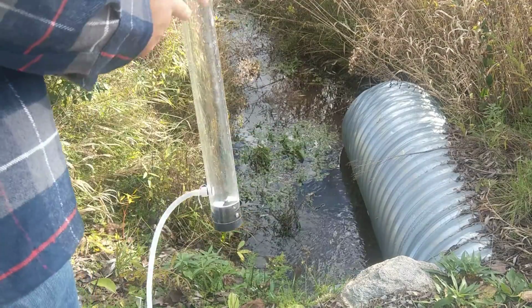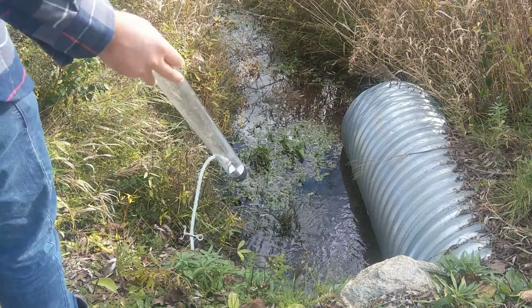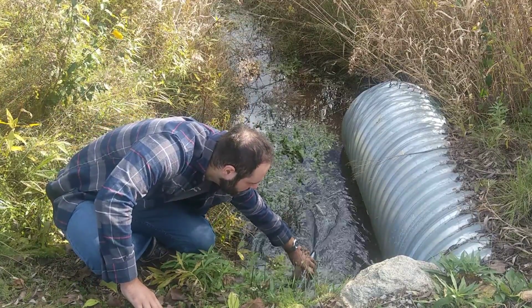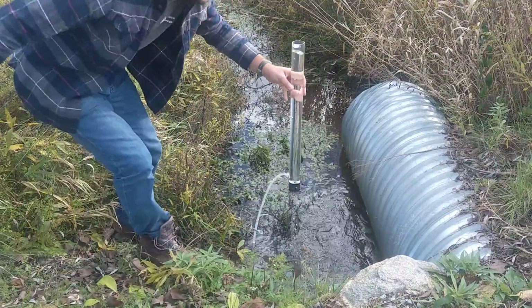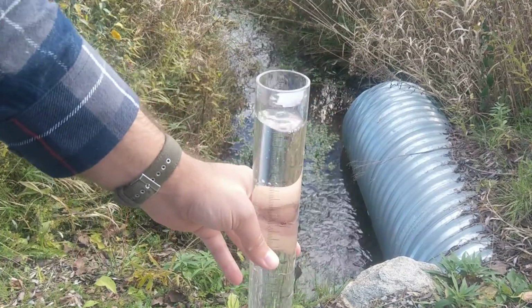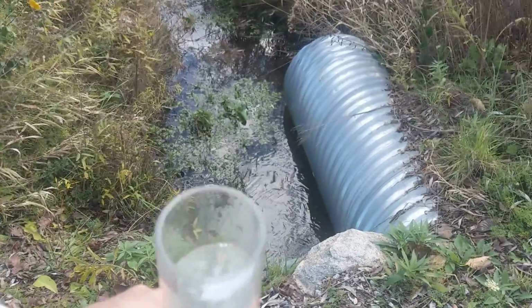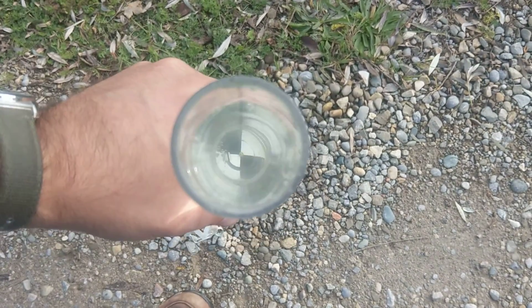After we're done with that, we'll measure turbidity, and you can actually use one of the corners just to fill this up. That said, I don't have one of those right now, so I'm just going to fill this up directly to the top. Now, it's very important when you're sampling that you make sure that you're not stirring anything up off of the bottom, because that will artificially increase the amount of turbidity. So if you look down, you can actually see the pattern.